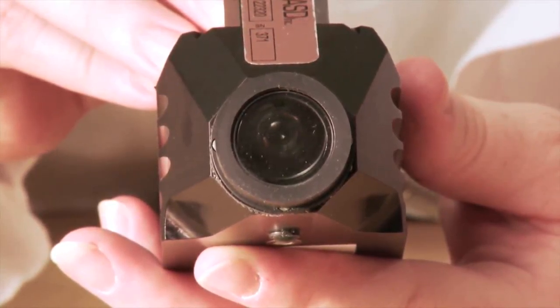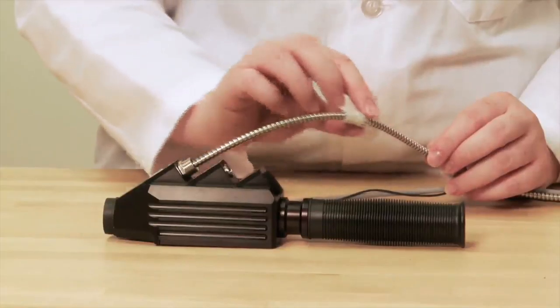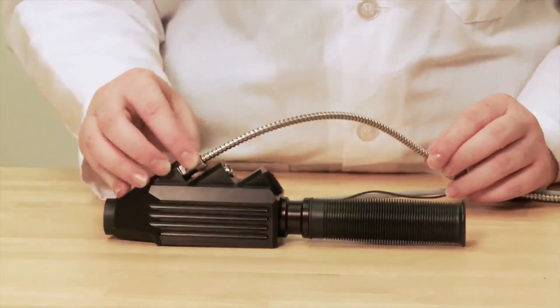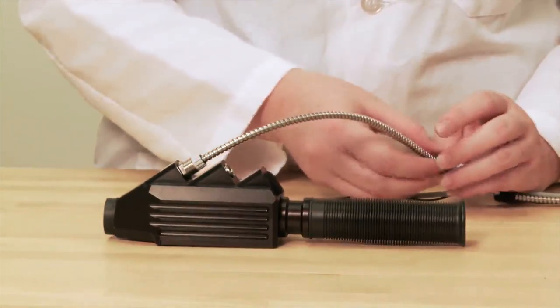While holding the fiber optic cable in place, slide the plastic strain relief sleeve into the accessory connector. Be sure that it is fully inserted.